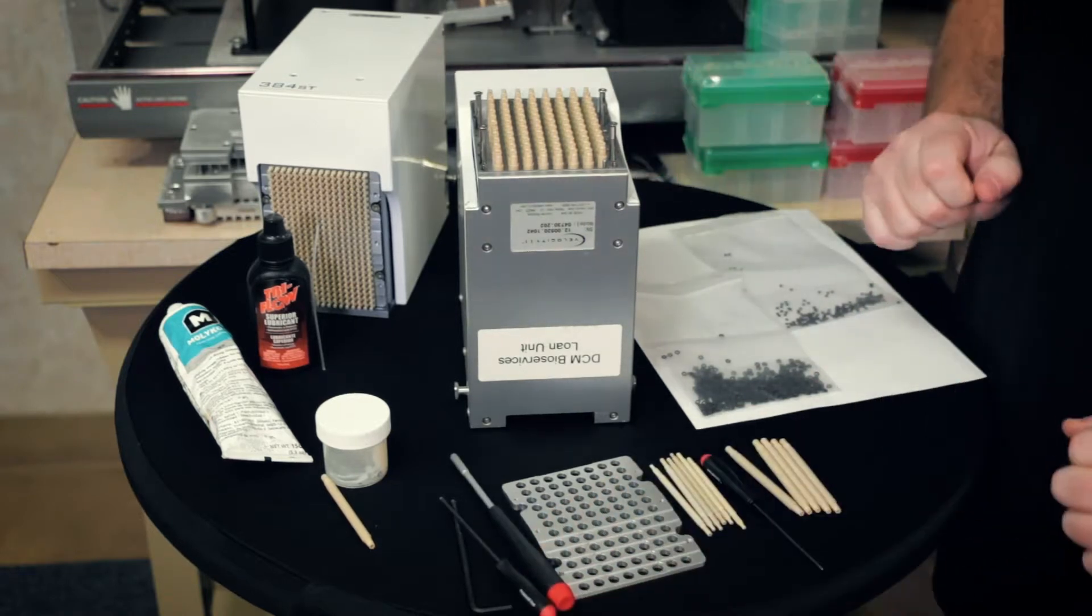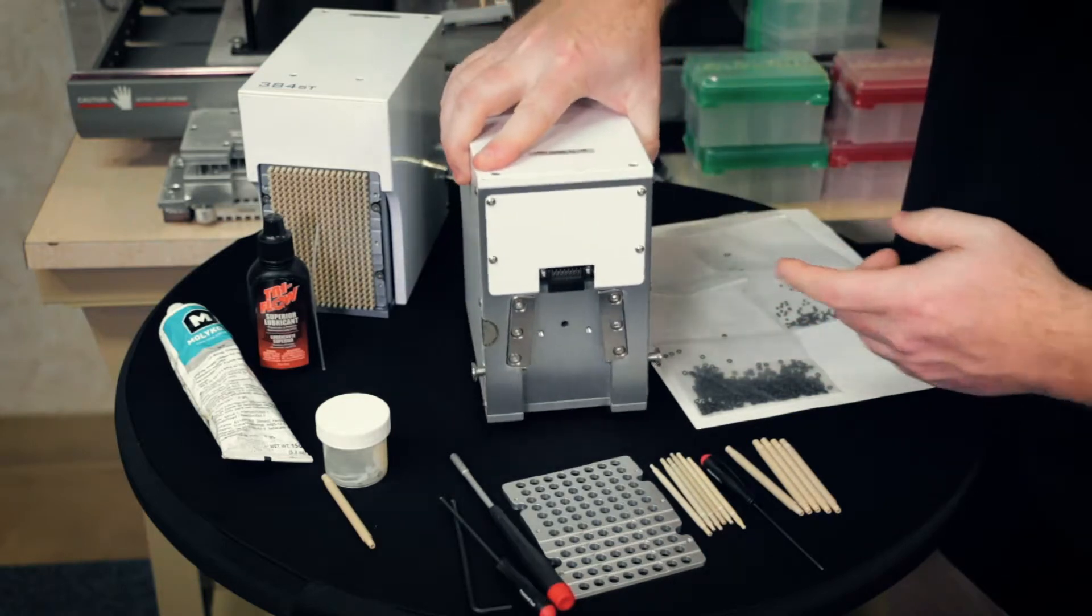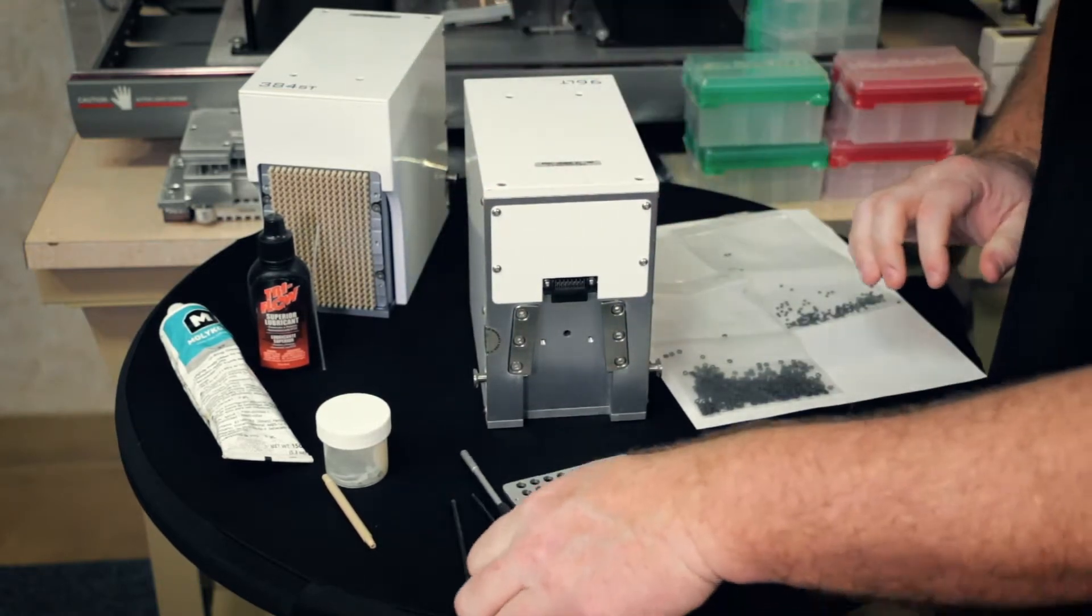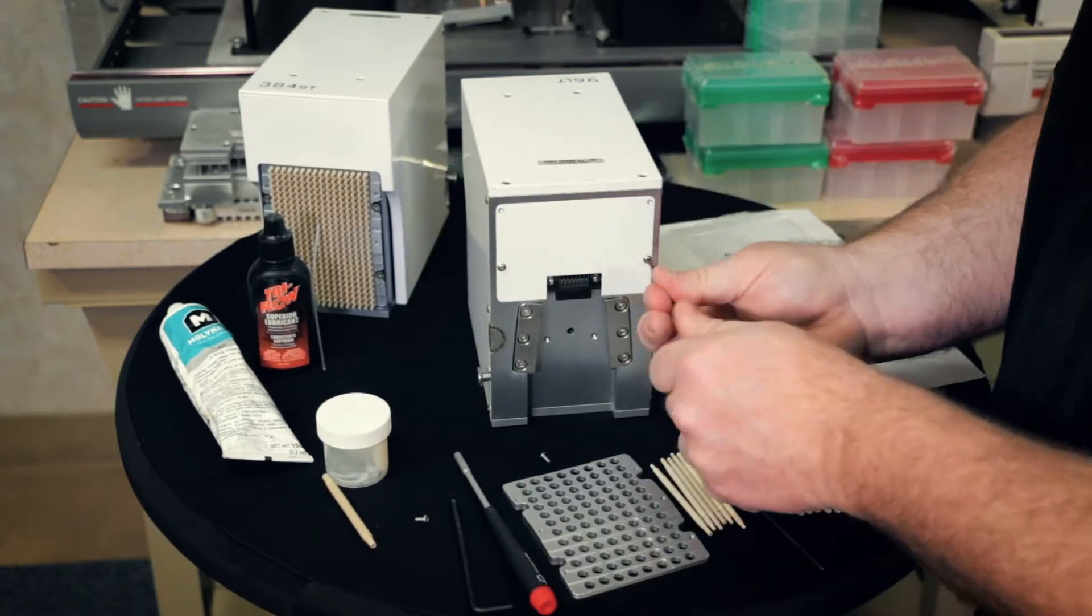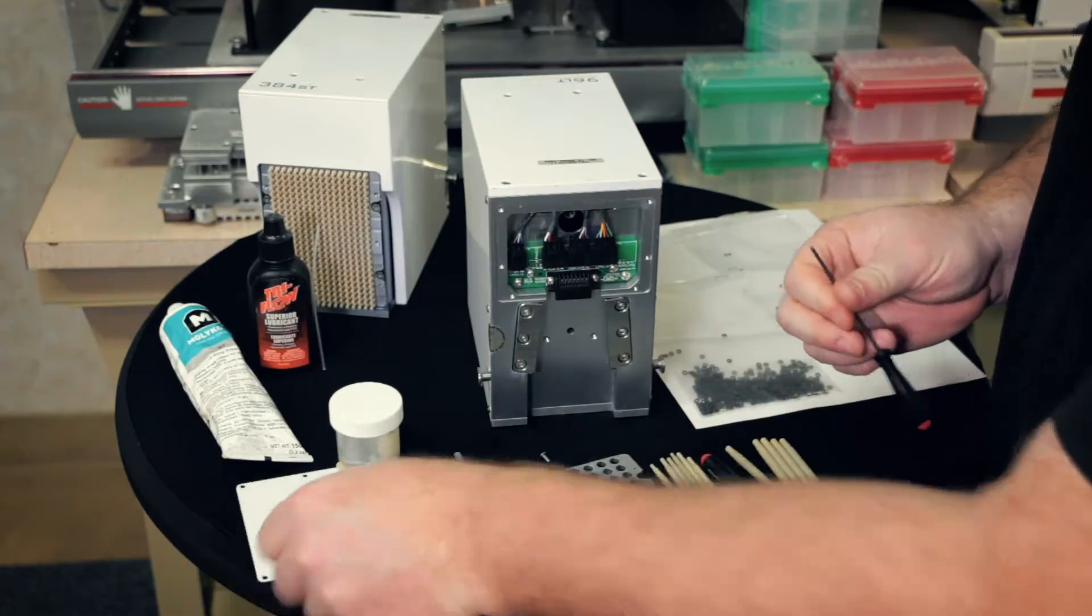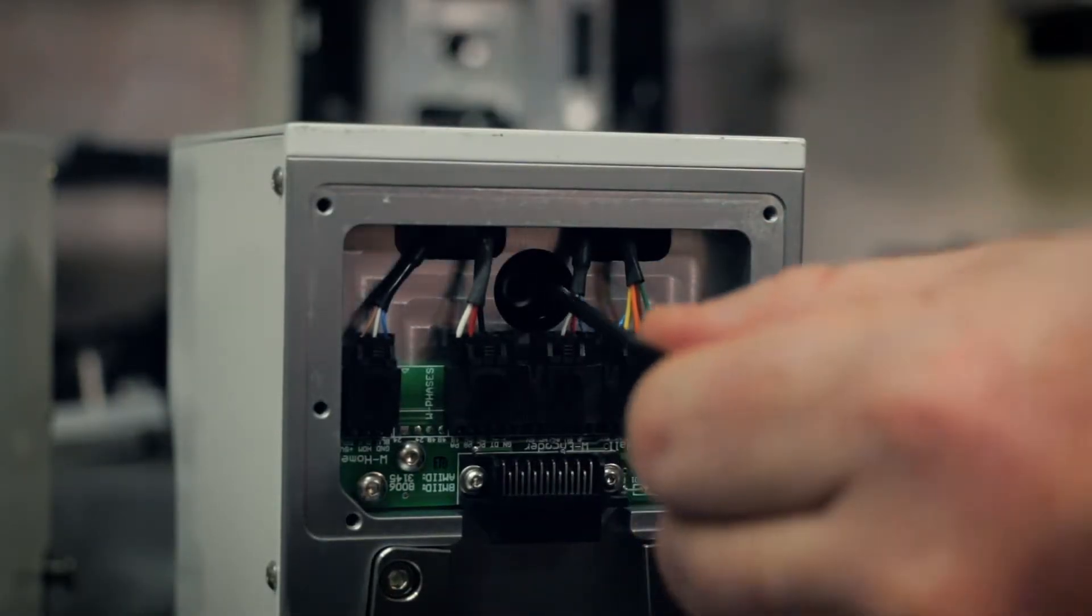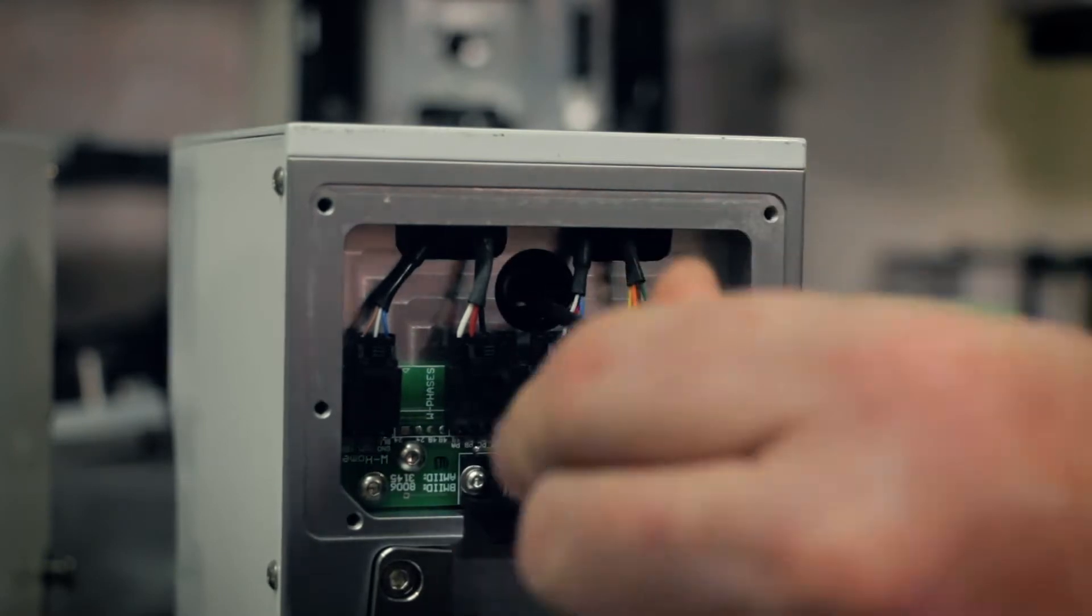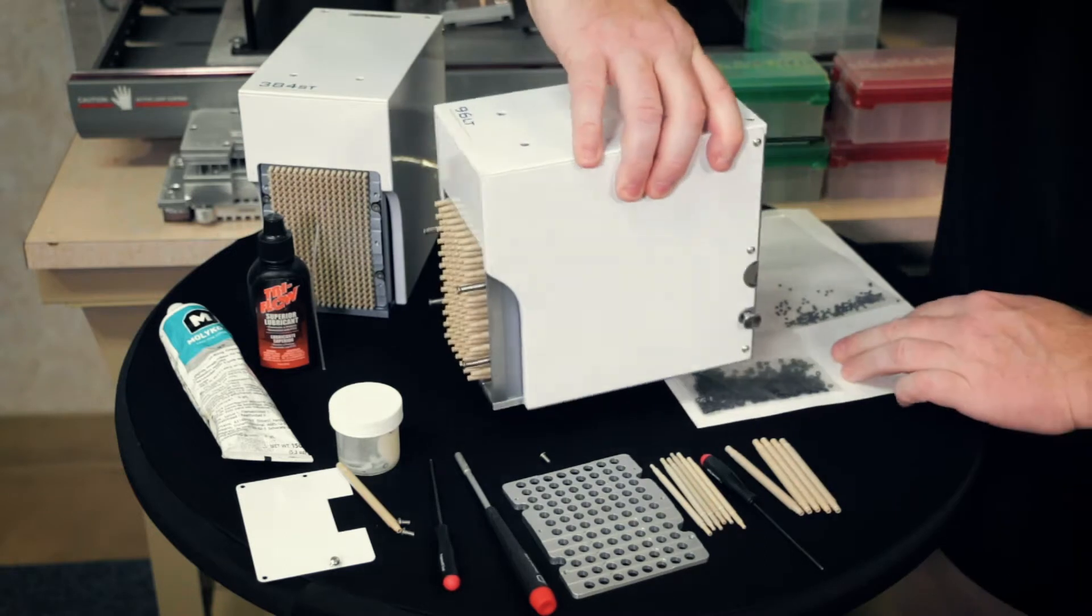Now we're going to need access to pull the O-ring off. So now we're going to have to take this plate off using the 2.5. The reason why we take this off, we're going to need access to the lead screw there. And it uses the three millimeter hex tool. Stick that in, and I'll kind of turn it so you can see.